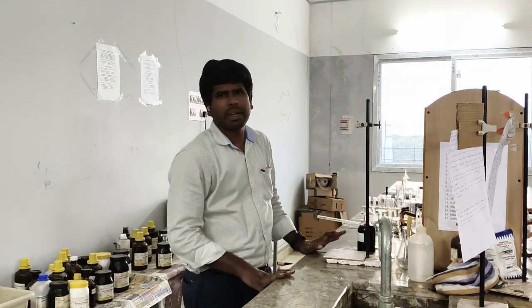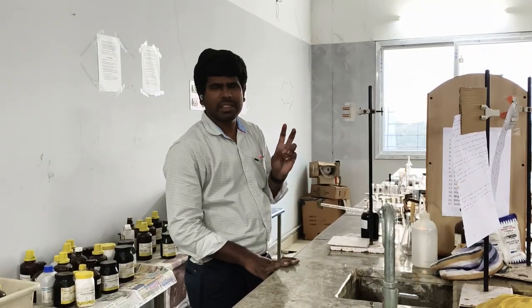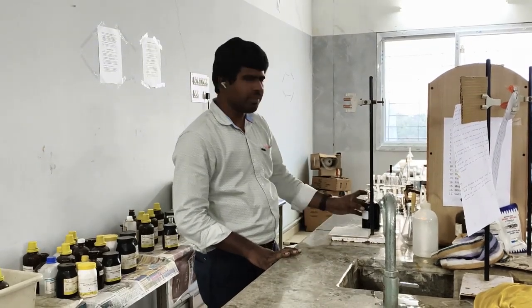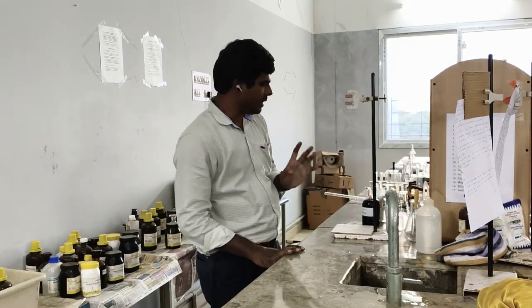Morning students. In chemistry practical, we have three experiments. First one volumetric analysis, second one inorganic salt analysis, third one organic functional group analysis. So first we will start from volumetric analysis. For volumetric analysis, we need three reagents.